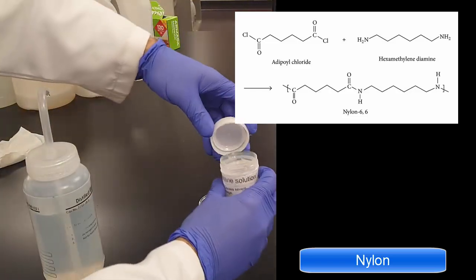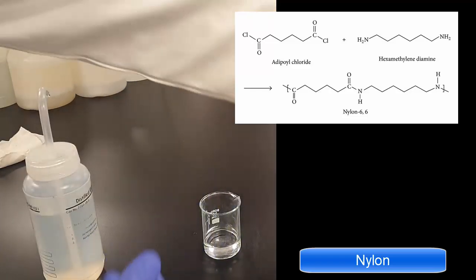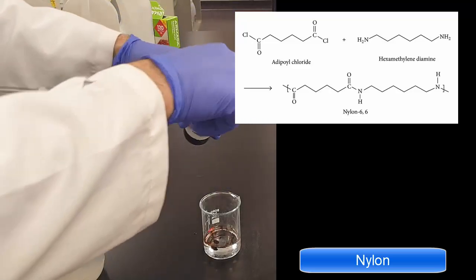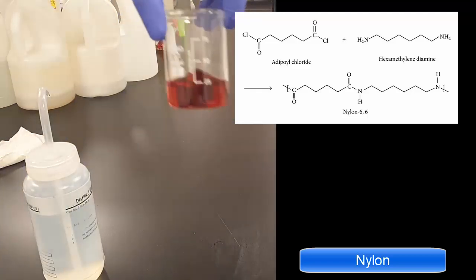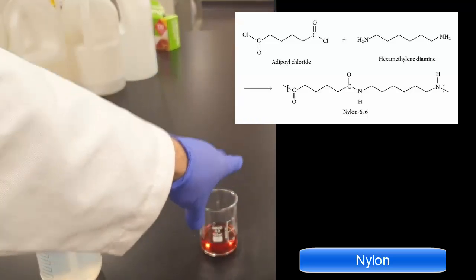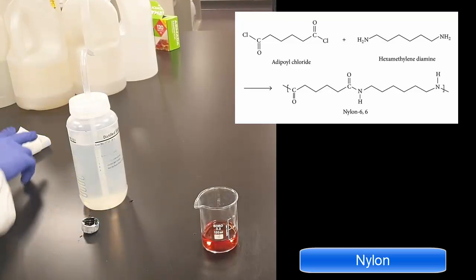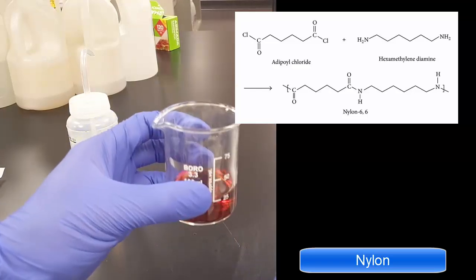And so what we're doing is adipoyl chloride and hexamethylene diamine. Now, it can actually have, instead of that chloride group, an OH group. So instead of having HCl come off, which is quite toxic, you can also have water come off and other small molecules as condensation. And you can see here that I just put a bit of red food colouring in. So one's more dense than the other. And I should have a careful look, but you should be able to analyse which one you would think would be more dense. And the carbon chains on both are 6,6, so this one's called nylon 6,6.